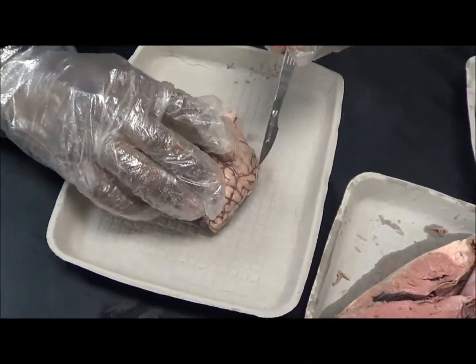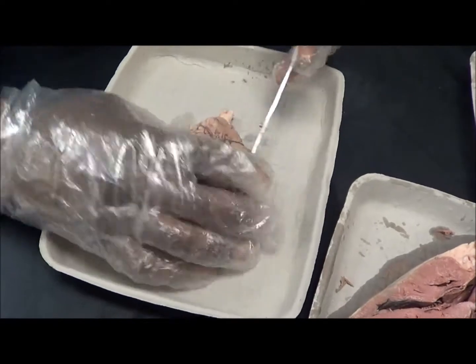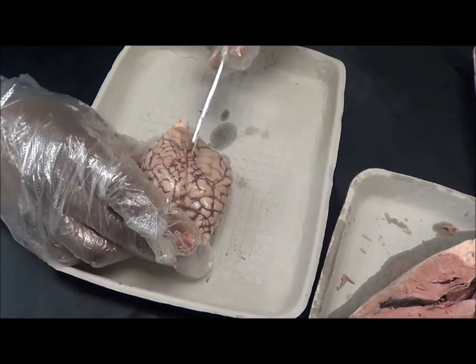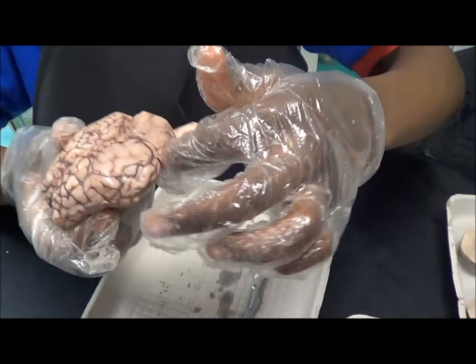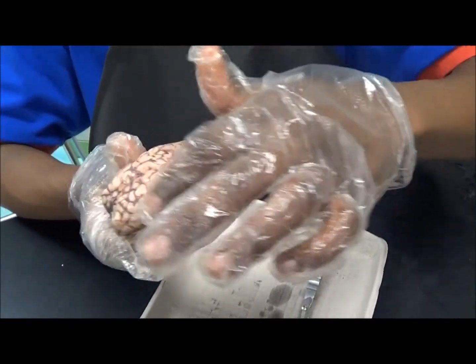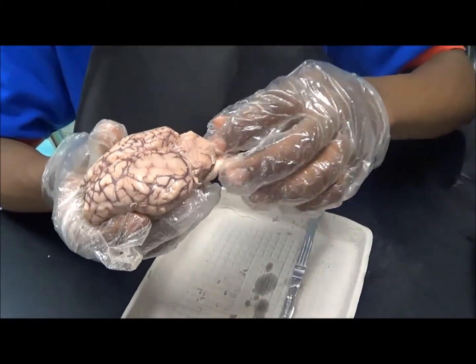Next, I'll be doing the brain. Before you place it on the dissection table, place it on your tray. This part right here is called the cerebrum, and this part right here is called the cerebellum.